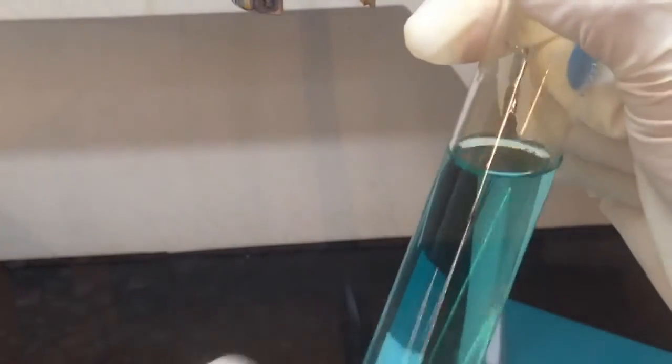So let's do some shaking, some mixing of the solutions. Okay, so we mix them. Oops, locked it. Mixing the solutions well, the color of the solution becomes bluer. The green color is still staying at the bottom, because I have added too much water. While I'm shaking, we are making the reaction more complete. That's why you can still see some brown gas coming up right above the solution.